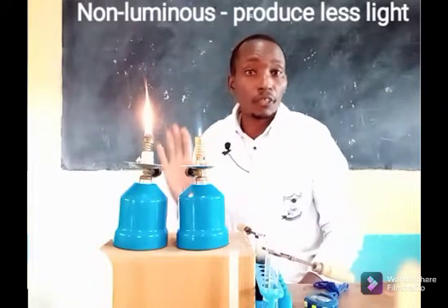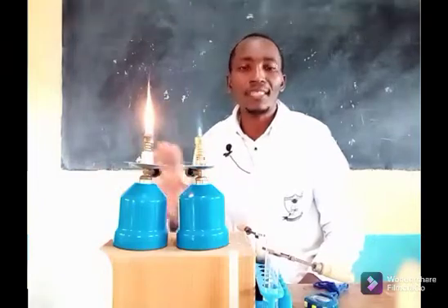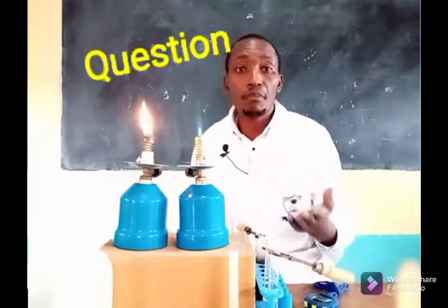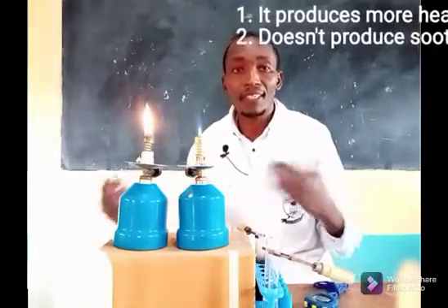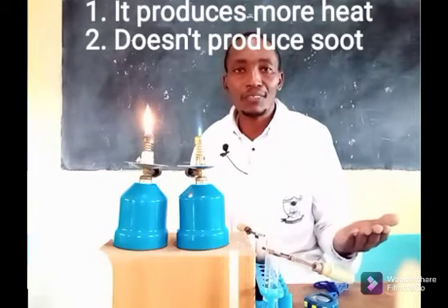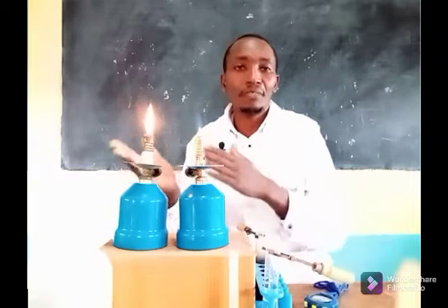In terms of light: the non-luminous flame is not very bright and cannot be used for lighting, while the luminous flame produces a lot of light. We prefer the non-luminous flame because it is much hotter and because it does not produce soot, meaning it does not dirty the apparatus — you will work with very clean apparatus.